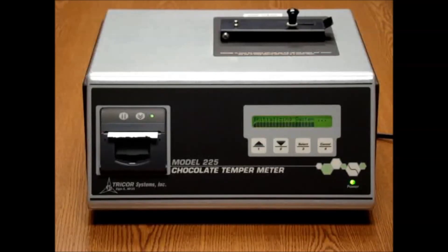Upon power up, the system will initiate a self-check routine to determine if any major problems exist. Once this is complete, the system may still need to reach proper operating temperature as will be indicated by the screen. This should only take a couple of minutes.